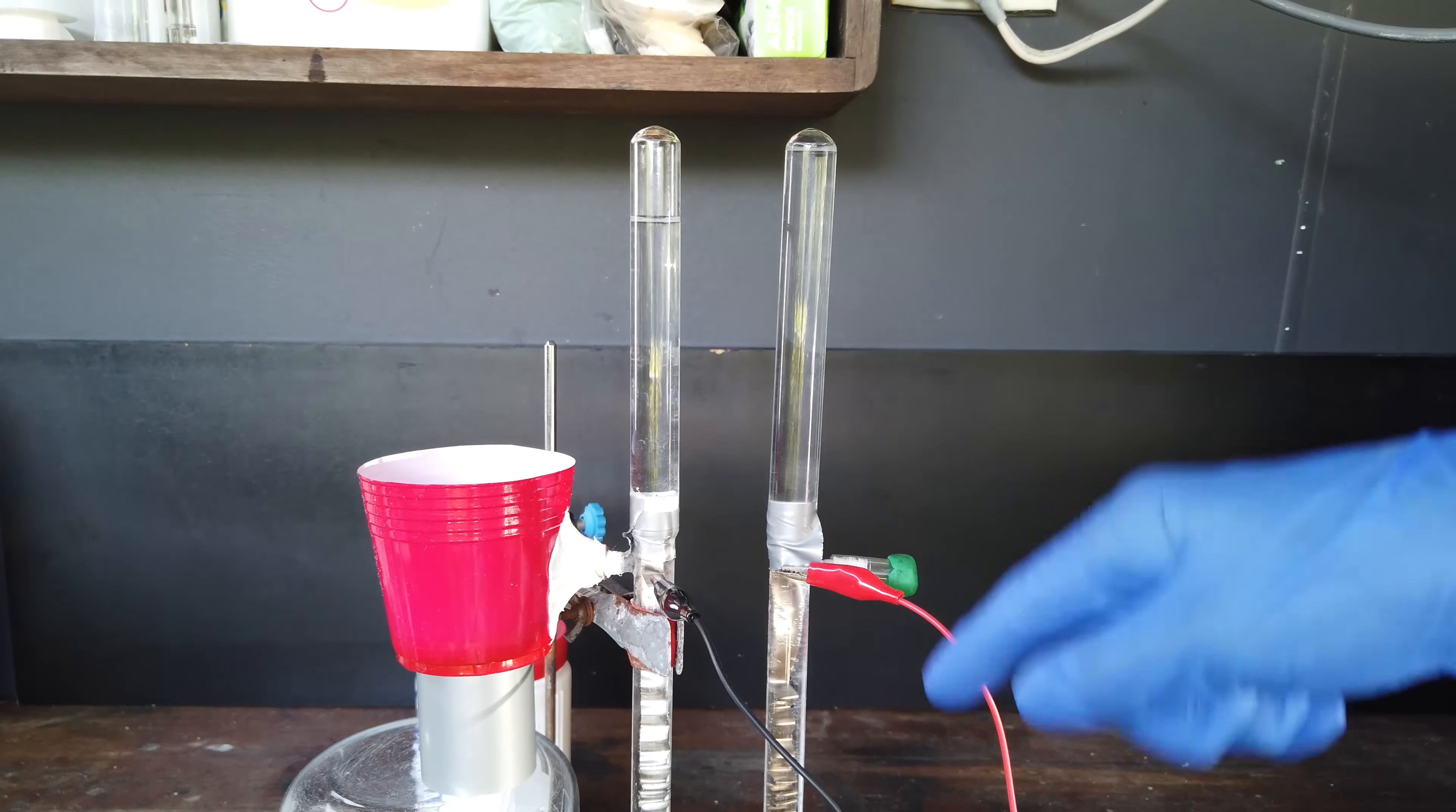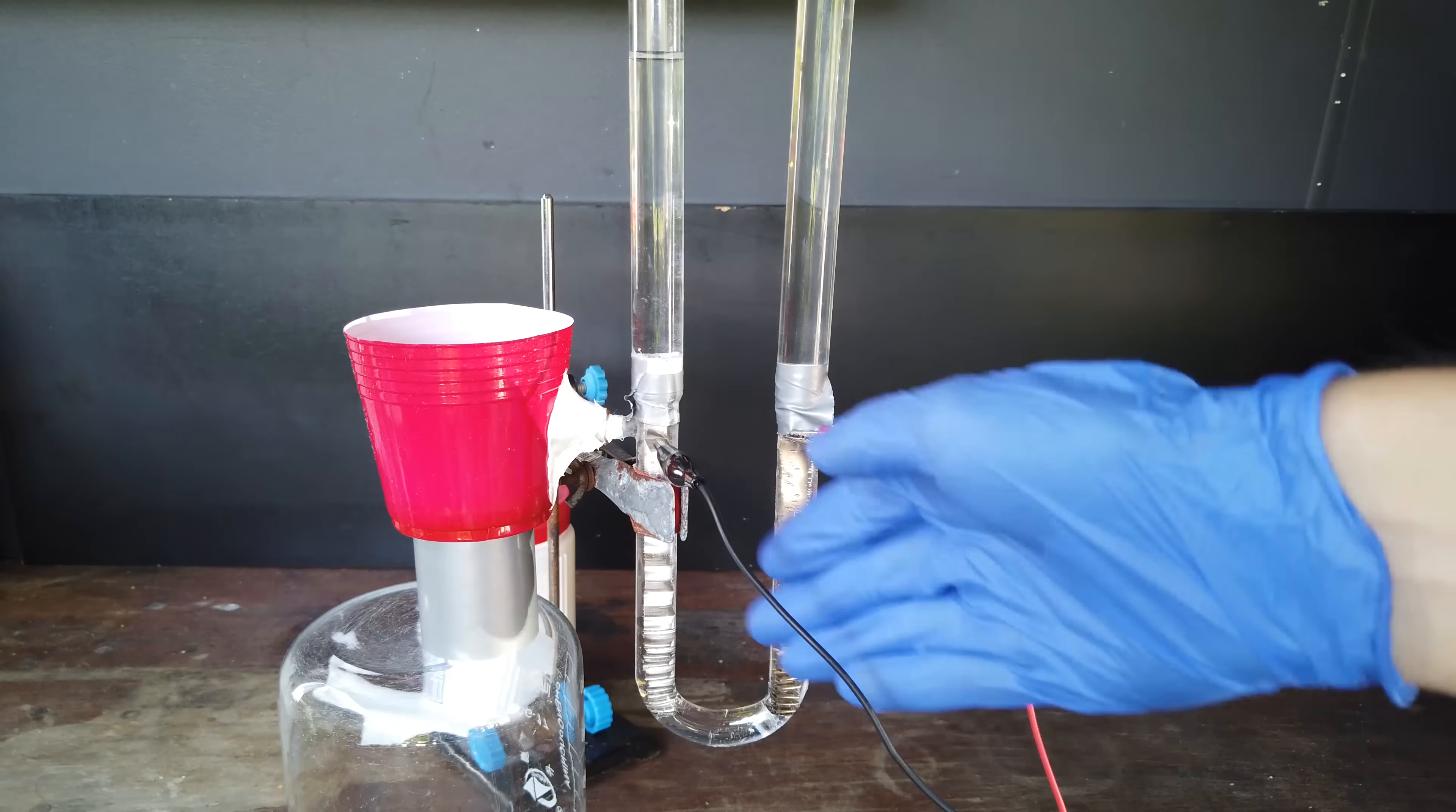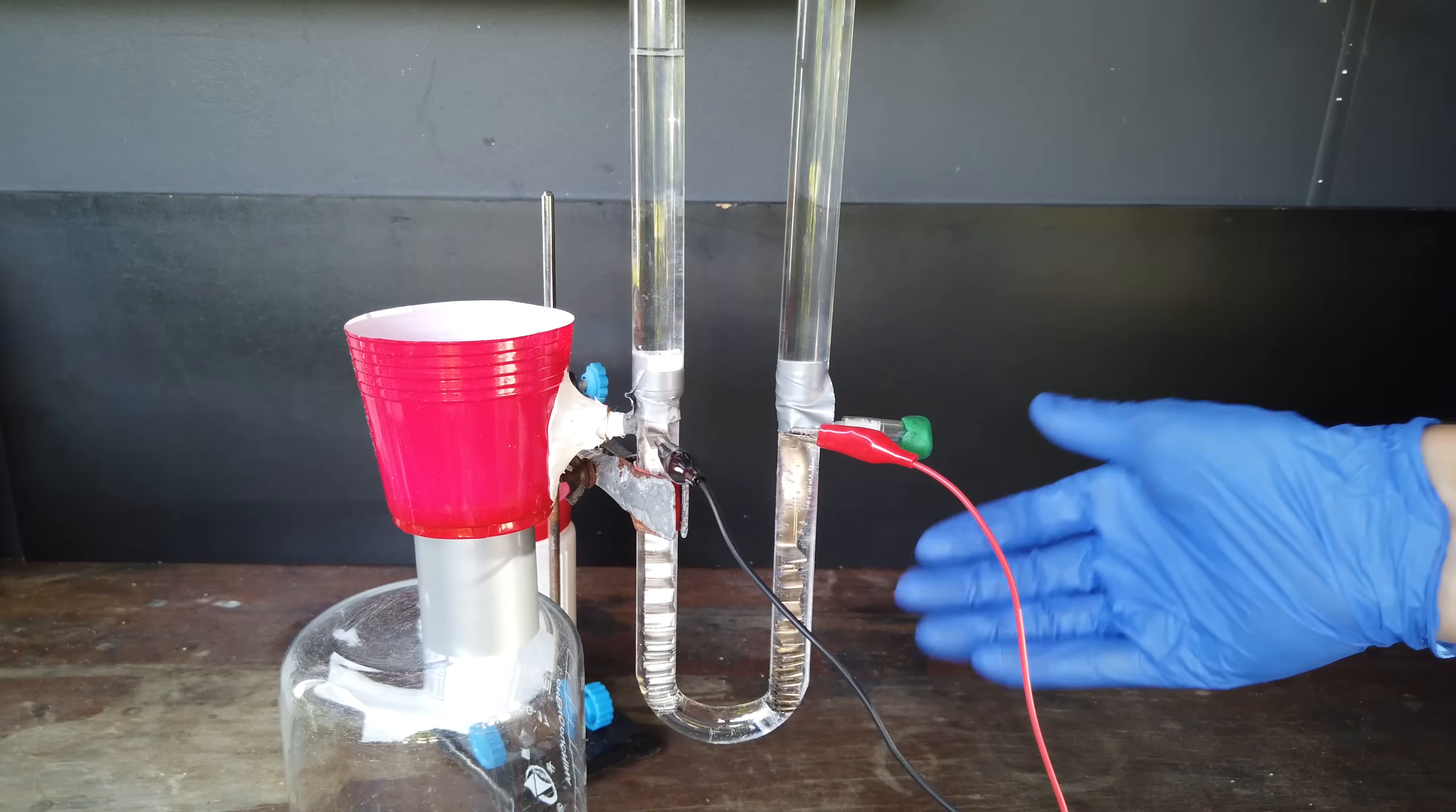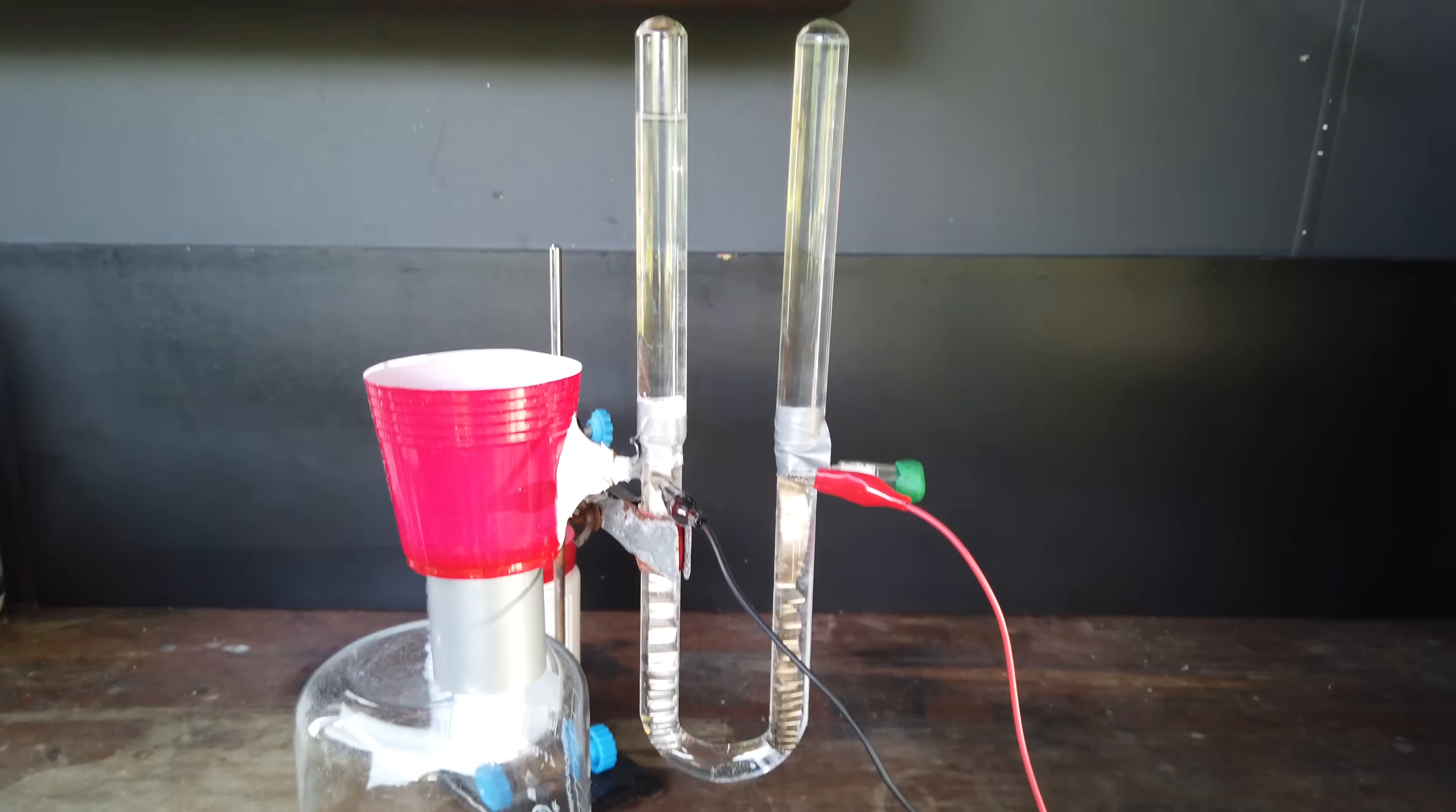But due to the fact that there are some side reactions occurring on the anode, I think you can see just a little bit that the anode is slightly darker than the cathode. And that's due to the fact that the nickel surface oxidizes slightly to generate some oxidized nickel catalysts on the surface, which is still conductive and can still allow for electrolysis. But they do subtract from our nitrogen yield.